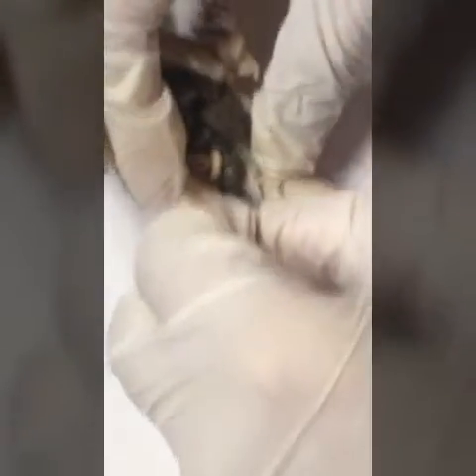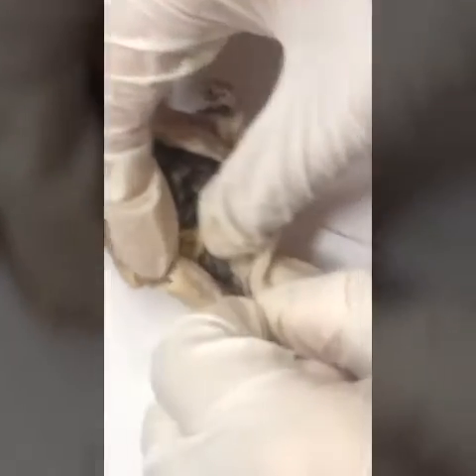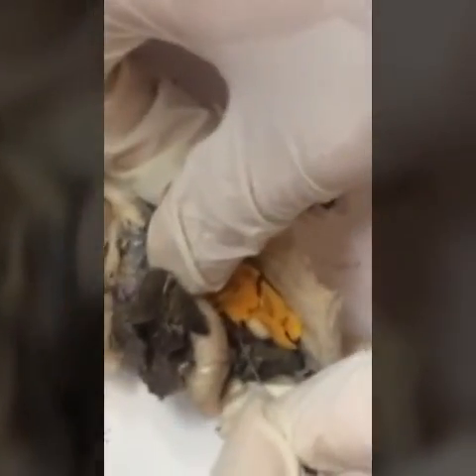Then you can see the urinary bladder here, like a filled sac. Then the cloaca right down there. Then you can see the gallbladder right here. Down below is the spleen right there.